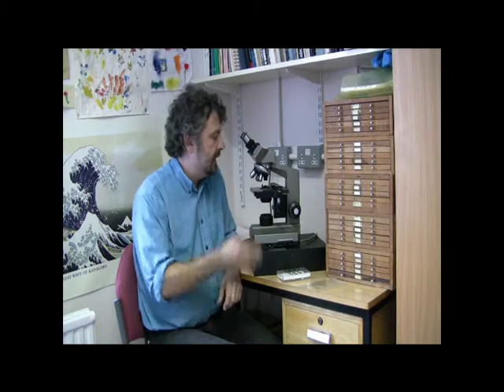Hello, I'm Professor Simon Hazlitt and I want to talk to you about how to examine radiolaria for scientific study. Radiolaria are commonly viewed for routine analysis using a transmitted light microscope such as this one here.